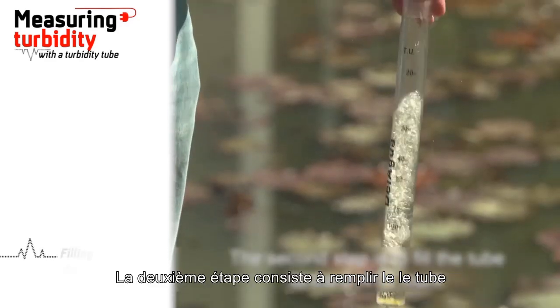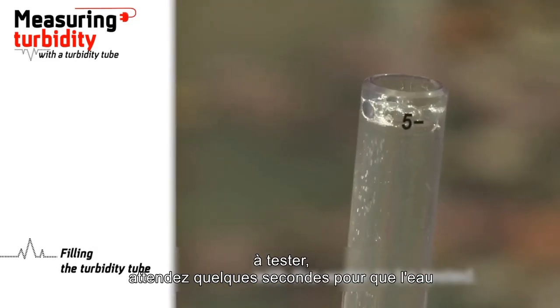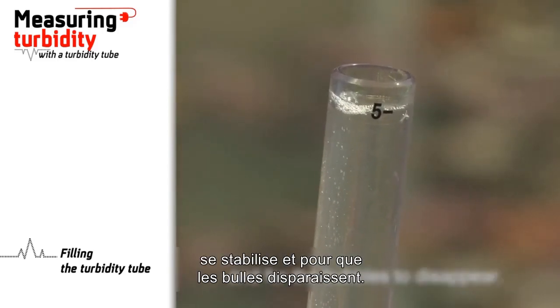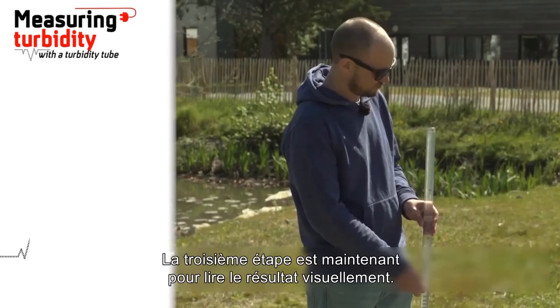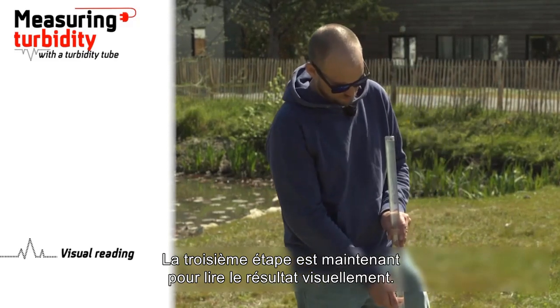The second step is to fill the tube to the 5 NTU mark with the water to be tested. Wait a few seconds for the water to stabilize and for the bubbles to disappear. The third step is now to read the result visually.